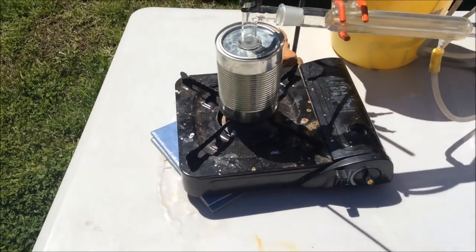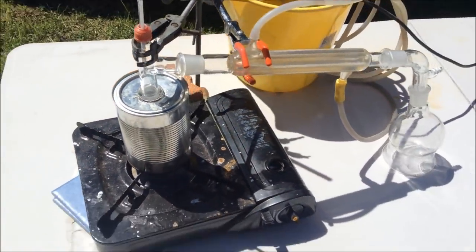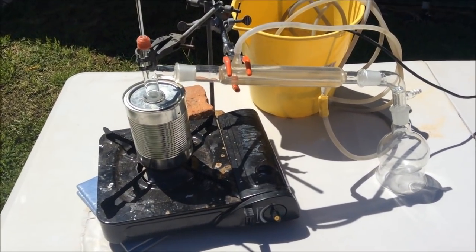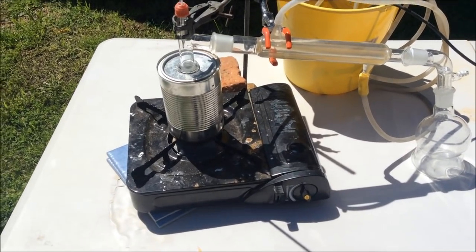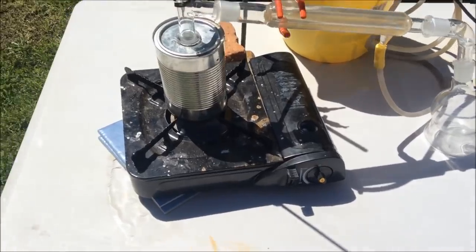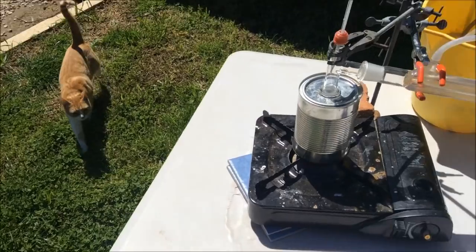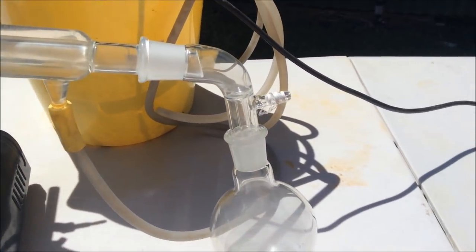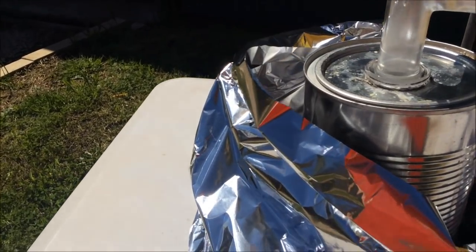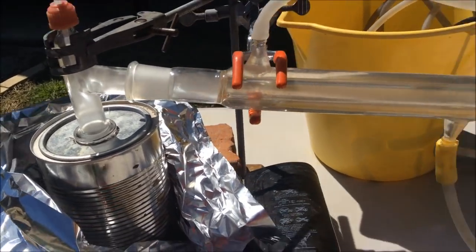All right, the dry powder is loaded in there. Condenser's running. I'm pretty sure I sealed this well enough. So I guess we just got to turn the heat on and hope it all doesn't burst into flames. We are basically distilling off a petrol-like product from something at 200 degrees. So we really do hope this joint seal holds and the cat doesn't jump up on the table. All this smoke is just pouring out the end here. So nothing's really condensing. The temperature's about 40 degrees, so I don't know what it is.